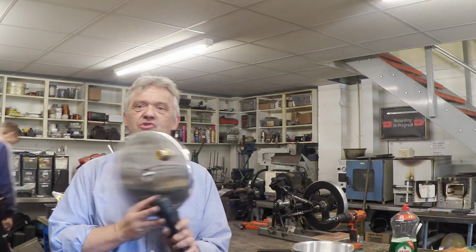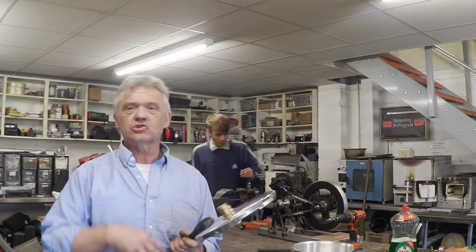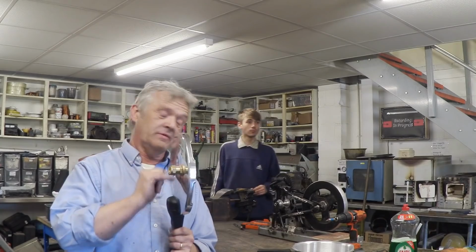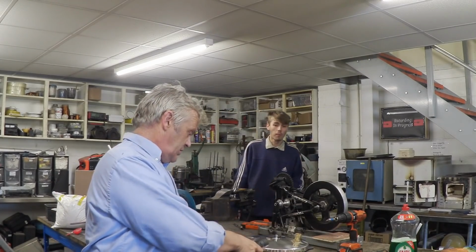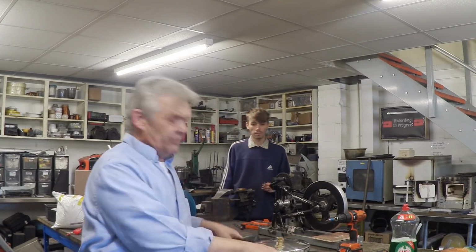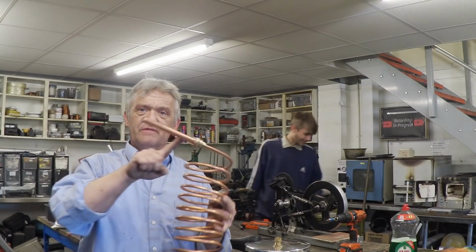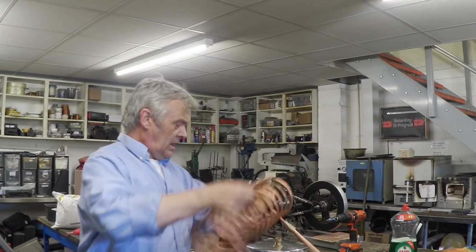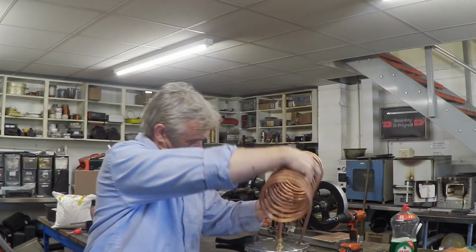So all I did with that was drill it out with a 25 mil hole saw, give it a bit of a freshen up, and then the tank connector went straight in there. That's got a 15 millimeter outlet, so that goes on like that. And then on our coil, we've got a bit of 15 millimeter pipe with a 15 to 8 millimeter reducer, and then that goes in like that. That is our distillation equipment done.